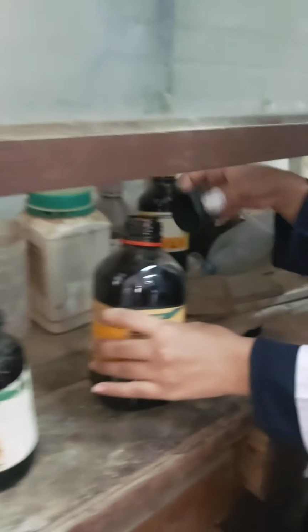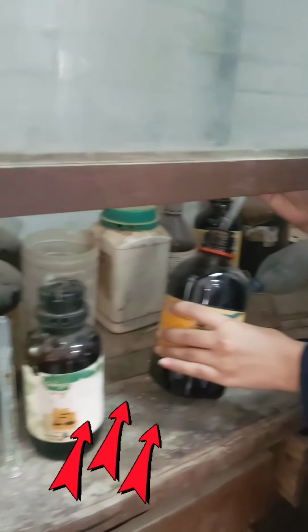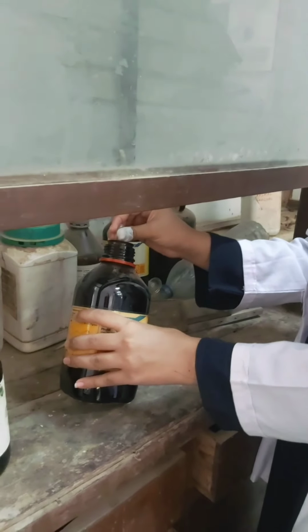They are good students, and they know how to convert grams to milliliters. And the rest are doing the mixing, which I can show you here. It's a toxic chemical, benzoyl chloride, which I mentioned earlier to my students, so please handle the fumes with care, and they are using the fume hood.